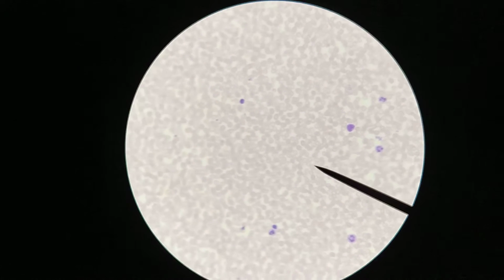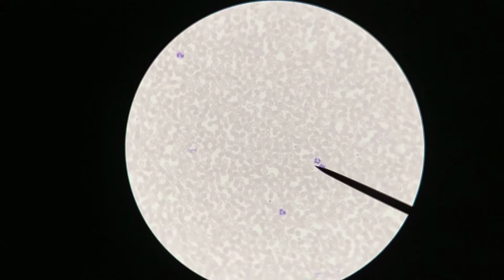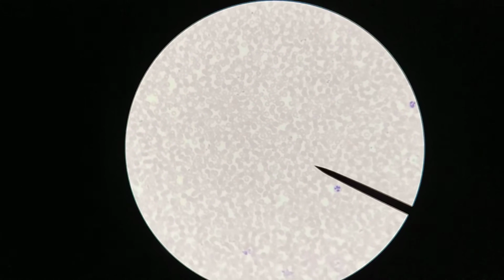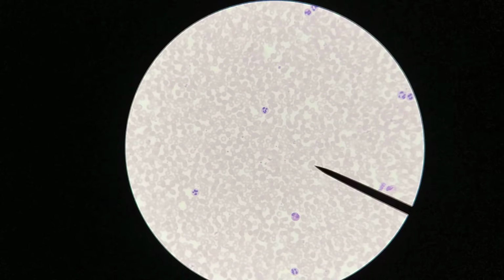And that makes sense since we talked about in lecture that neutrophils are the most common white blood cells. Again, this is your first line of defense. So these are going to be plentiful, because they need to be able to be deployed on short notice. They need to be able to enter tissues whenever there's any kind of infection detected.